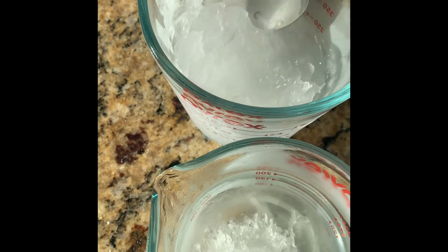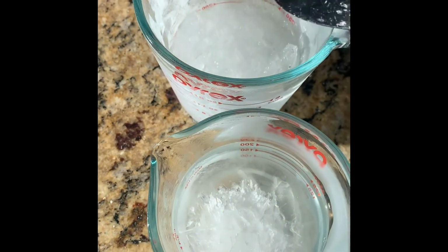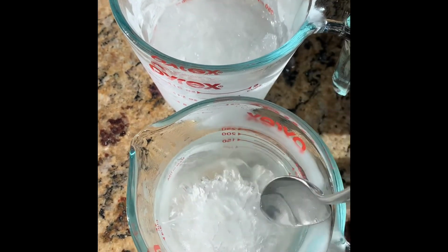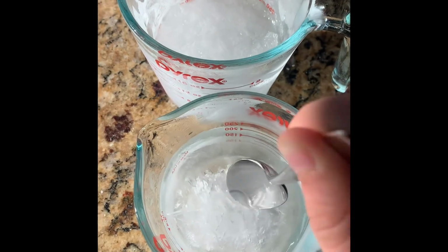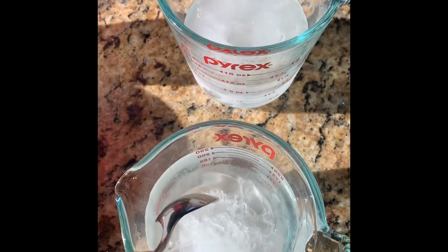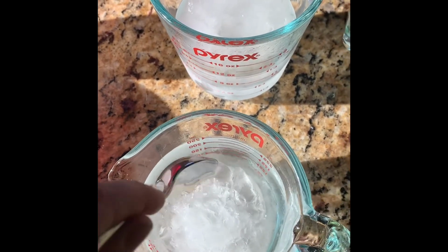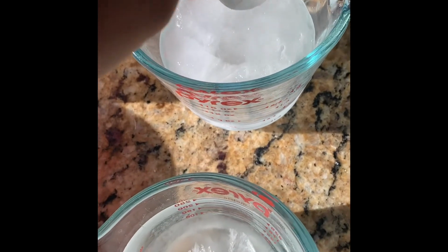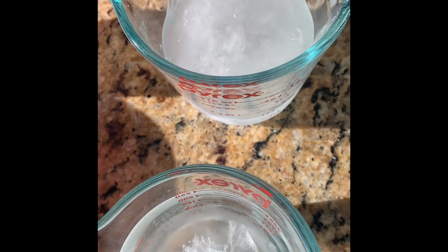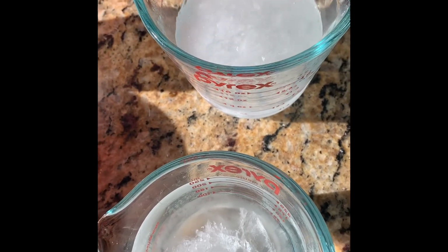All right, and you can see that that's melted a lot more, exposed to the same amount of water, whereas that one is still hard. It's literally just the water on top of this blob of ice. So I let them sit for a little while. And you can see that one's melting quite sufficiently, whereas the other one is still just water on top of a glob of ice.